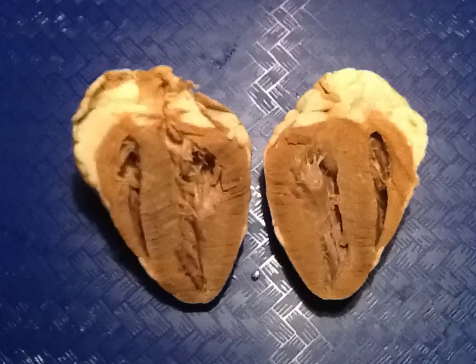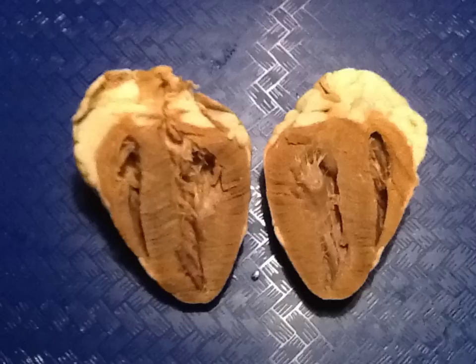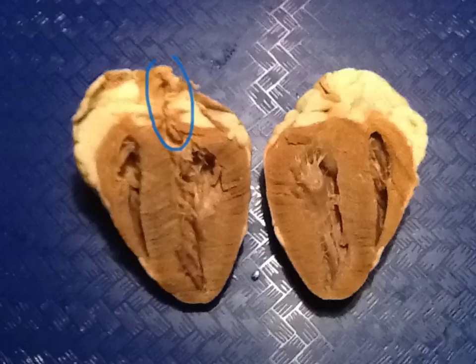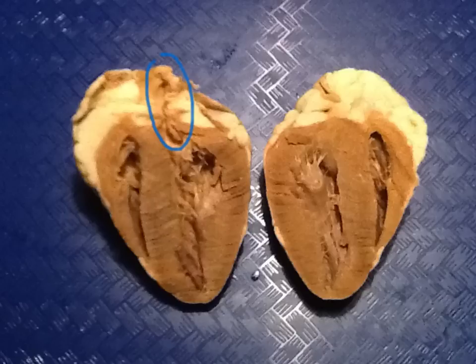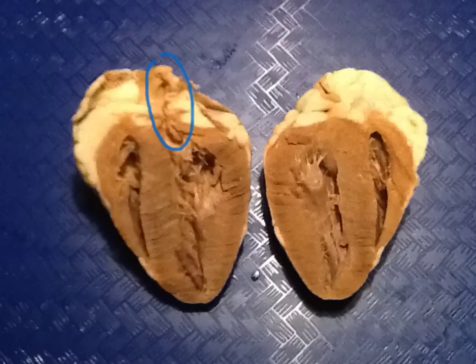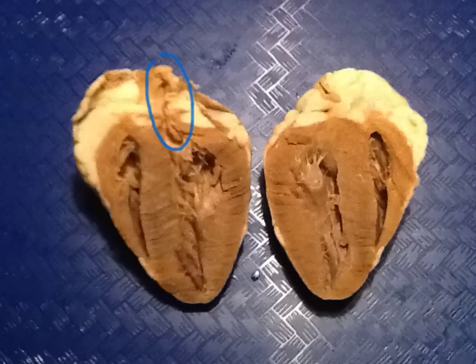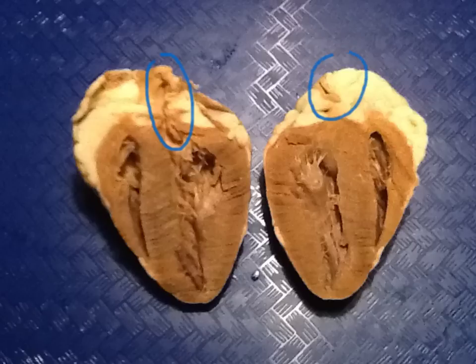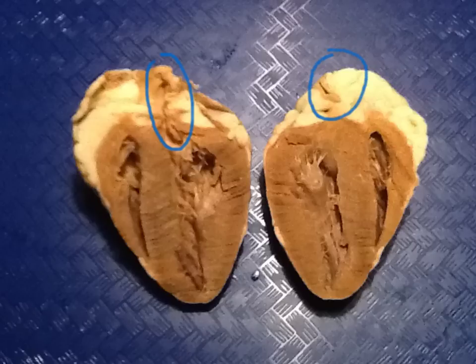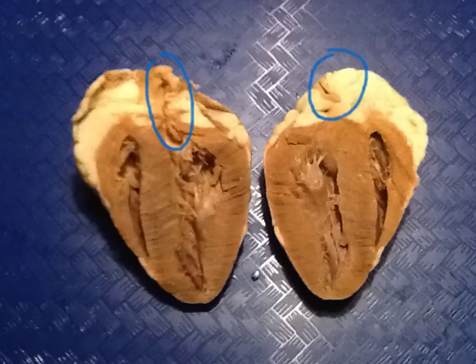Next, let's look at the four main blood vessels of the heart. Here's the aorta — the main blood vessel that blood travels through to go to all parts of the body. Over here you see the pulmonary artery, the blood vessel through which blood travels to the lungs.